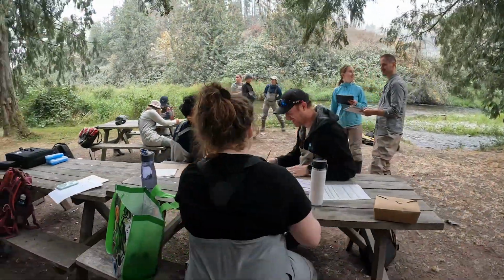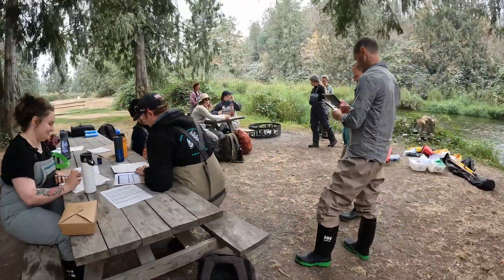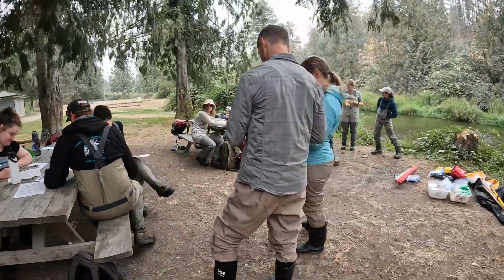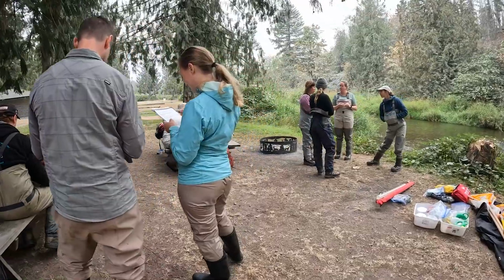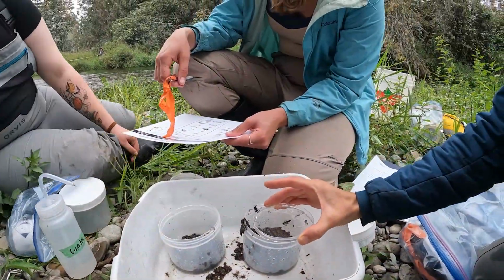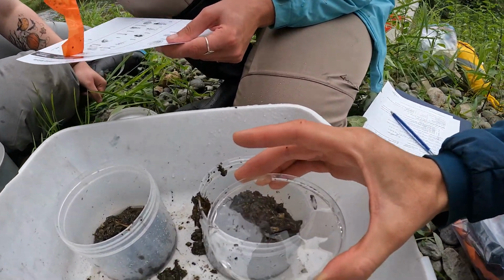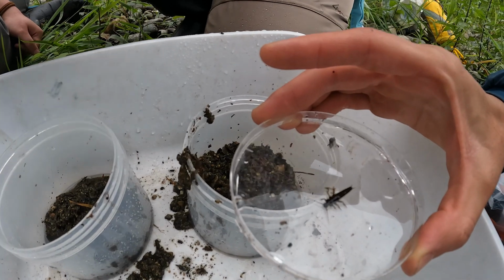STREAM is a community-based, Canada-wide biomonitoring project led by the Hajibabaei Lab at the University of Guelph's Centre for Biodiversity Genomics. Through STREAM, we assess DNA sequences from benthic macroinvertebrates, which are small bugs that are sensitive to environmental change and inform us about aquatic ecosystem health.